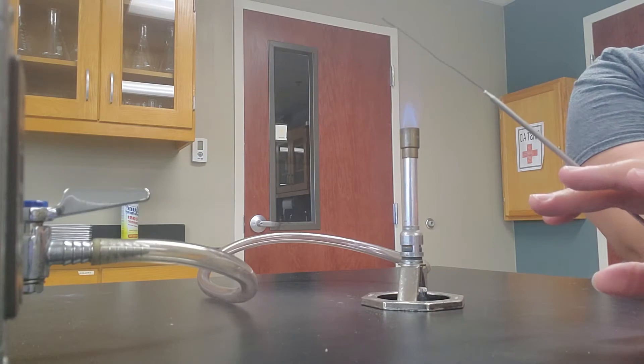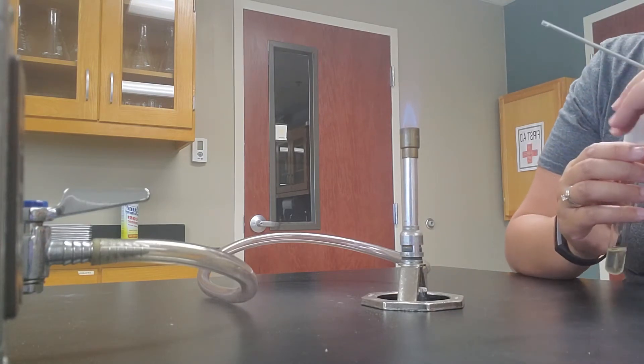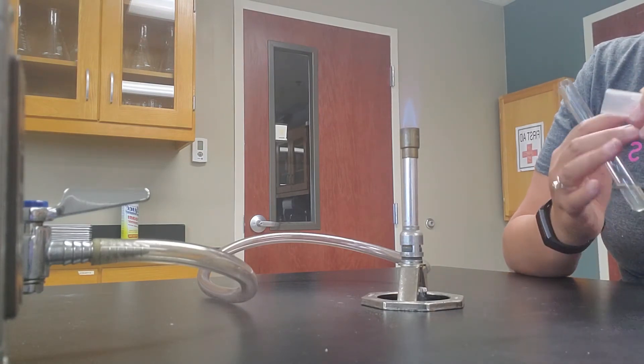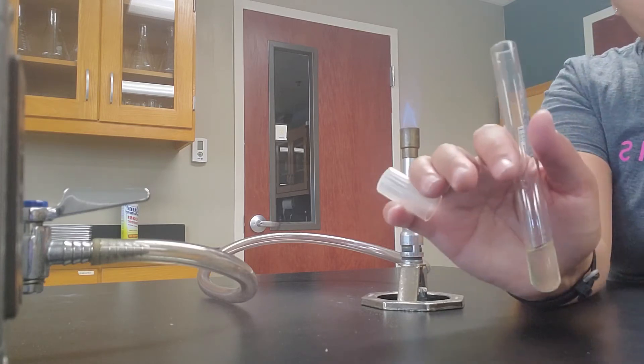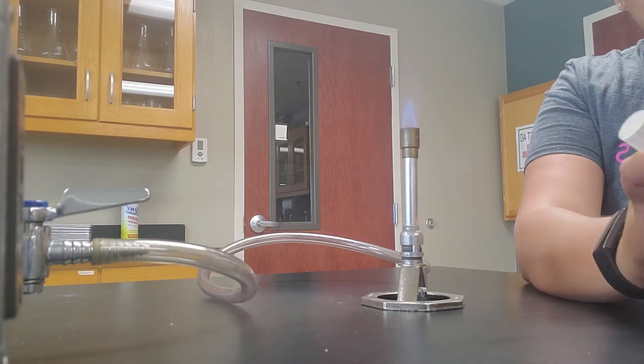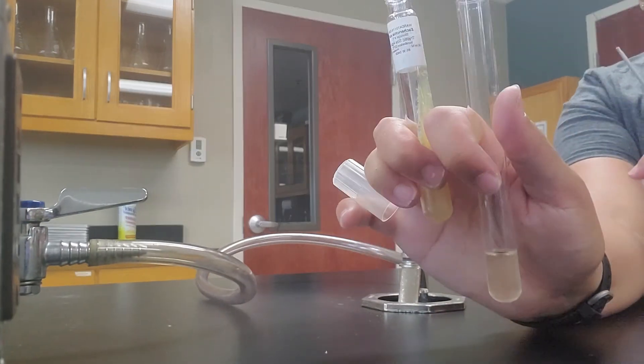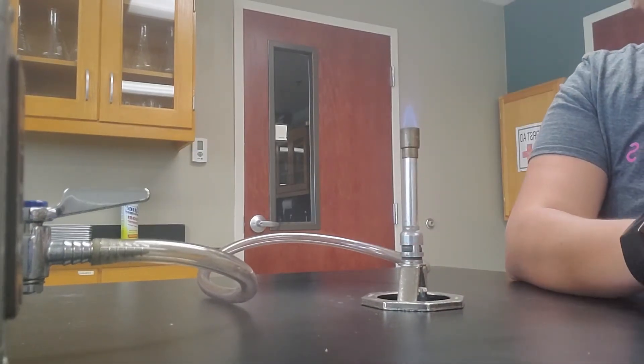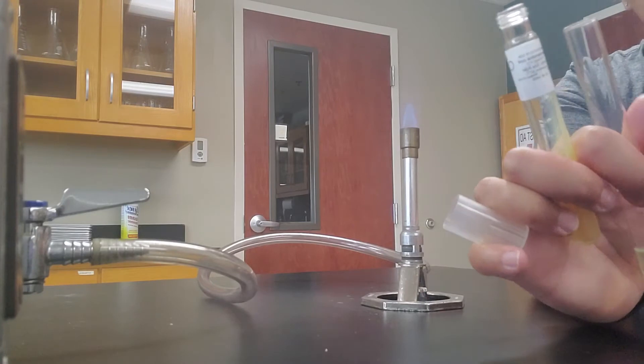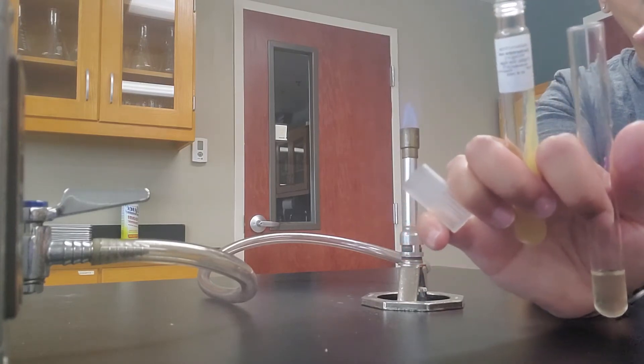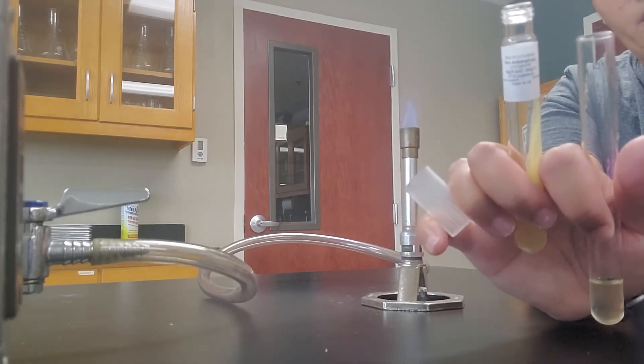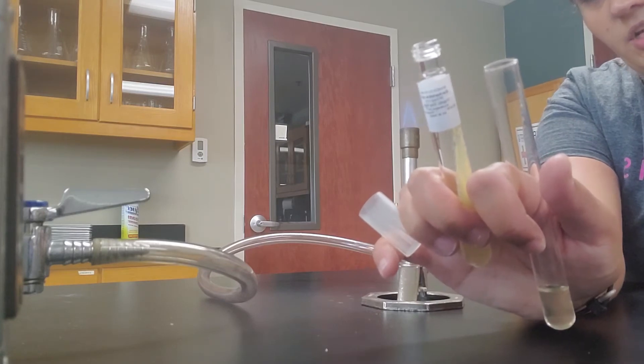Once you're done with that, you want to make sure that that cools, because if it doesn't cool, you're going to basically destroy your bacteria. So what I'm doing here is I'm trying to hold these tubes in such a way where I'm holding both tubes. And what I want to do is I want to hold the caps away from me. So I'm going to transfer from this one here to this one here.